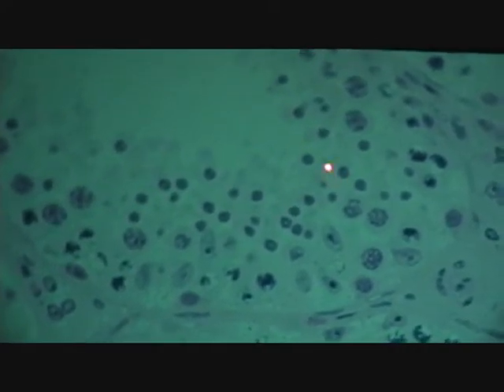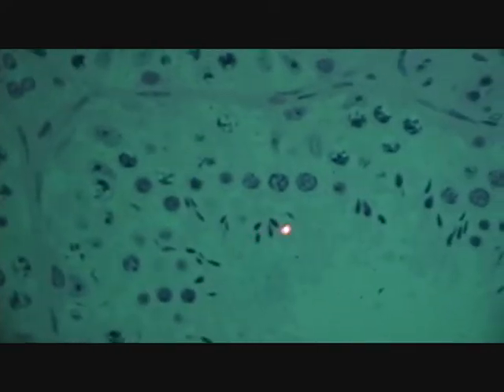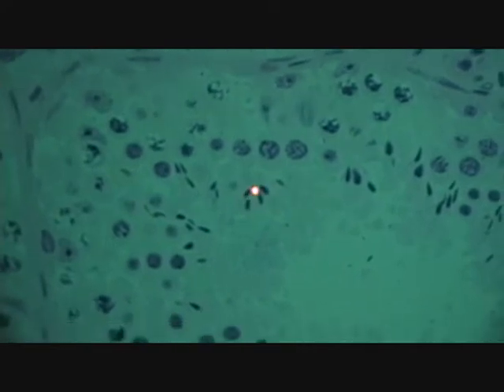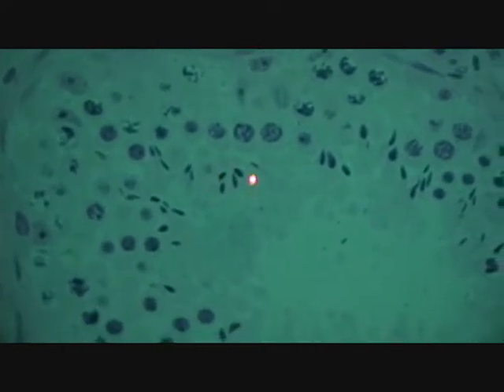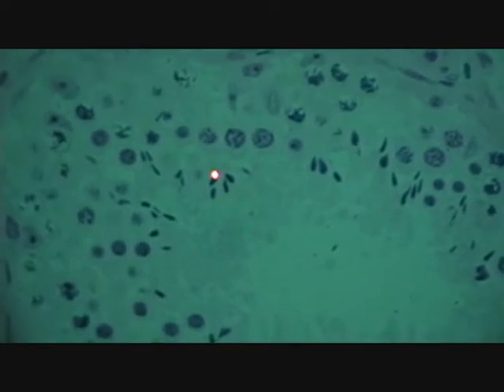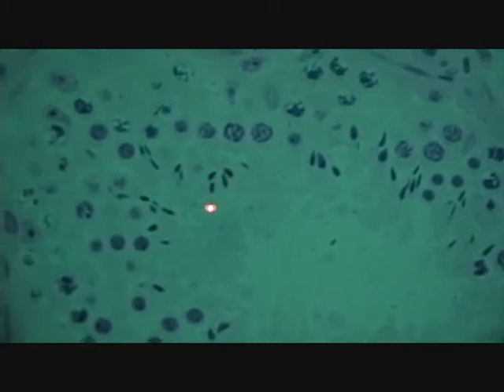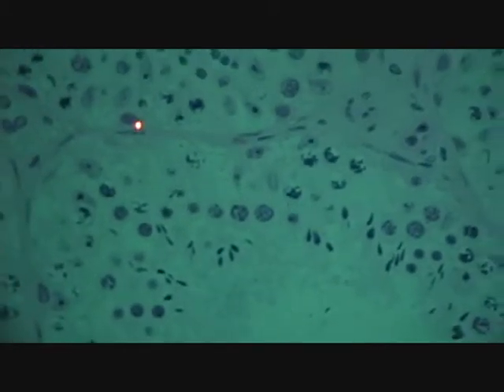Now beginnings of the gamete cells, the cells that can achieve fertilization once they've matured to look like this. Boat-shaped nucleus tells you it's the spermatozoa, and that these are now flagellated. They actually don't move until they're at the end of the vas. Just flow right along with the seminal fluid. So that's the spermatogenic line.